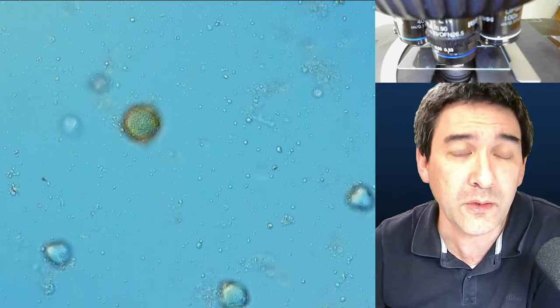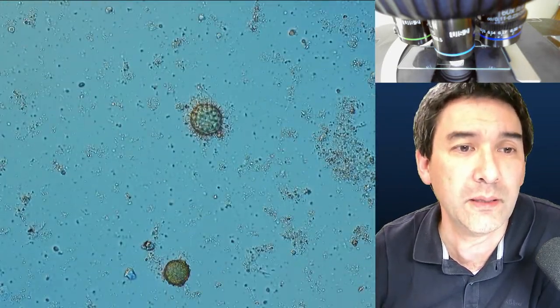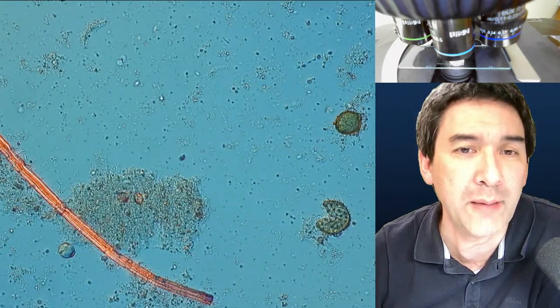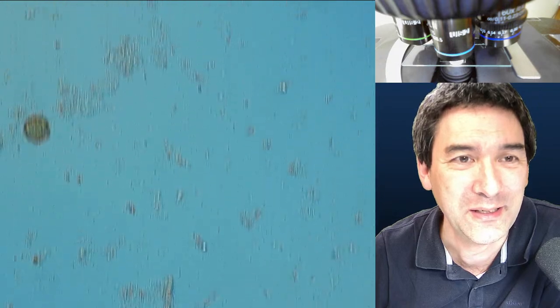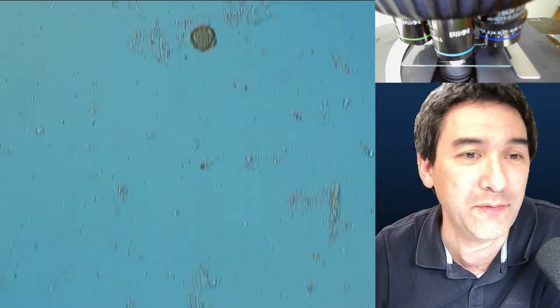Using my 60x objective, when you put honey directly under the microscope, you see a lot of tiny debris, but all the larger circles you see are pollen. There's also something that looks like a fiber — either a contaminant or something else. If you put honey directly under the microscope you're rarely able to find such a high concentration, so you need to concentrate it. A couple of months ago when I did something similar I also found some bee parts. It's also a good way to check if your honey is actually natural, since these days artificial honeys are available.